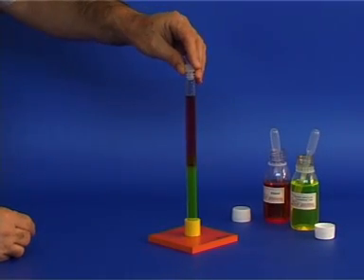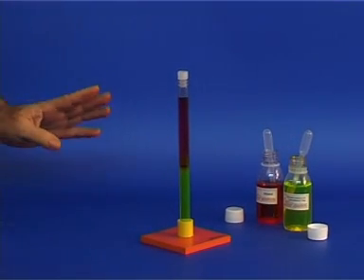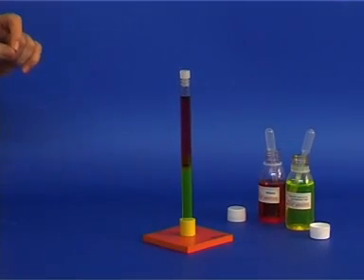Put the stopper tightly in place. Now we are ready to perform the experiment. What will happen to the total volume of the liquids if we mix them?